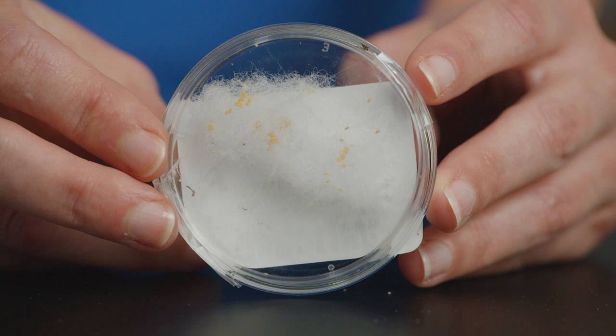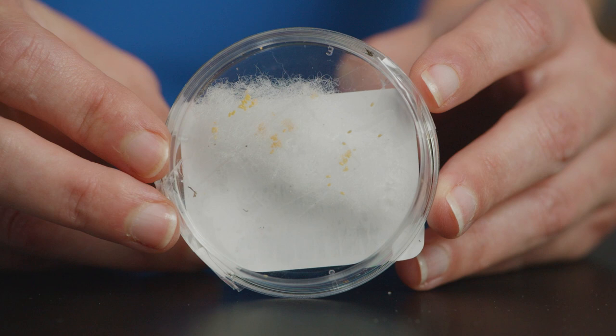The eggs should be yellowish-orange. The color will gradually change to deep orange just before hatching in about four days, depending on the ambient temperature.